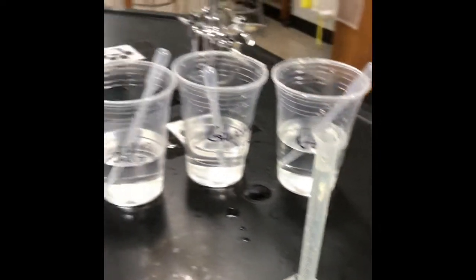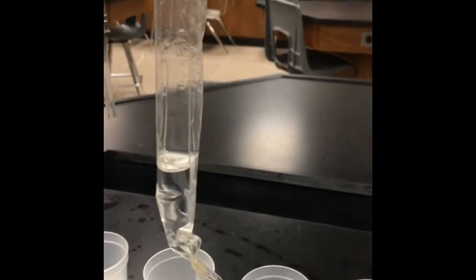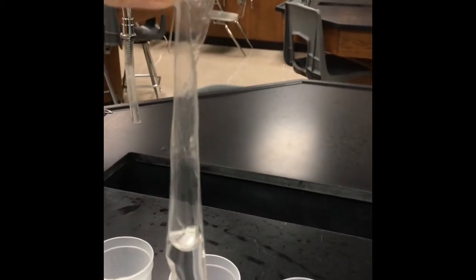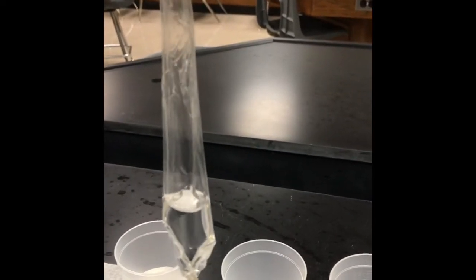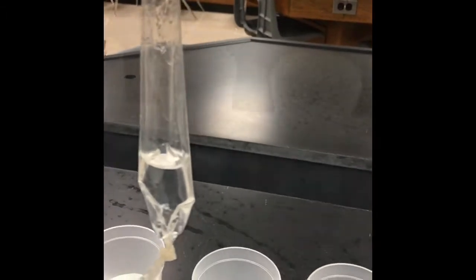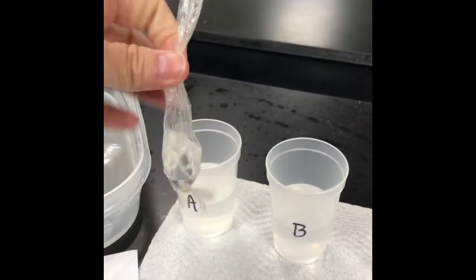I'm ready now to transfer that into the dialysis bag. So I'm just going to pour it from the graduated cylinder into the bag. Okay, so here is the little dialysis bag with the 10 milliliters of glucose. I need to knot the other end so that I have a bag, but I'm going to leave some room for expansion. I don't want to tie it really tight. I want to make sure I have some room in there in case water is going to enter the bag. Okay, so here's my first bag. I've got my 10 mils of glucose inside my dialysis tubing.